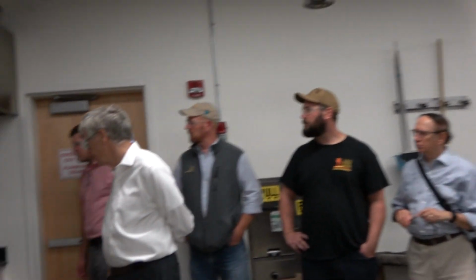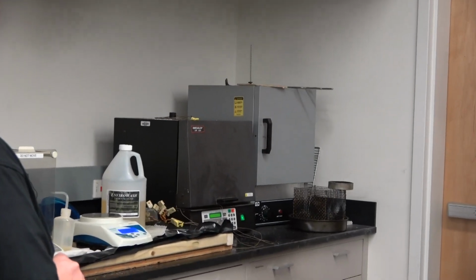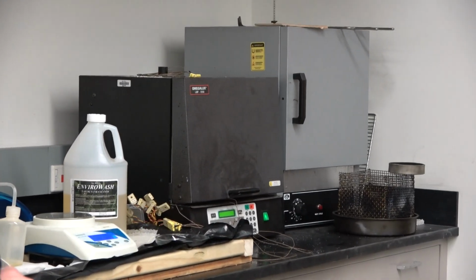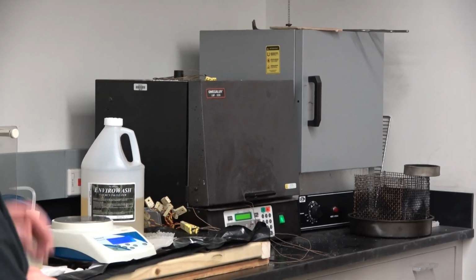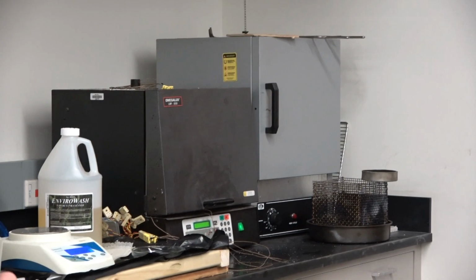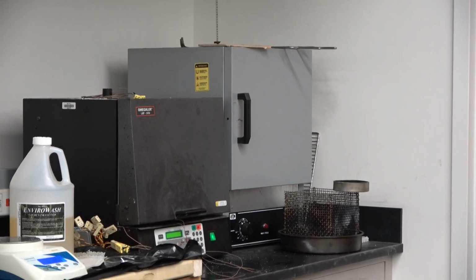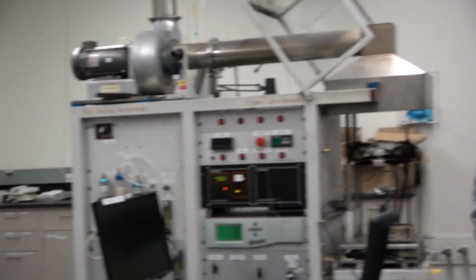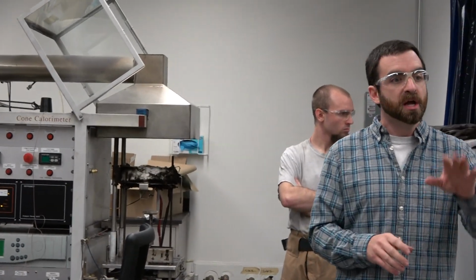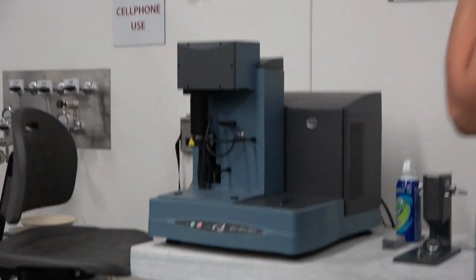In addition to the cone, behind you we have muffle furnaces. The smaller, darker gray box is a 1100 degree centigrade muffle furnace. Right now we're actually doing client testing on spontaneous heating. Next to that is just a small convective oven. That's very often what people like Giovanni or Javad will use for drying and conditioning their samples for pine needles and such.